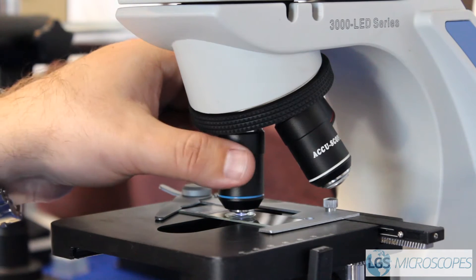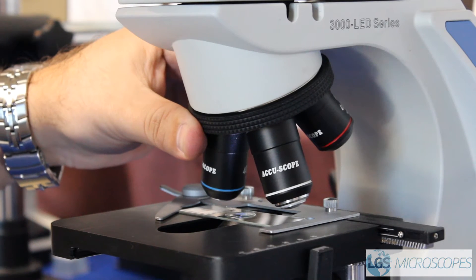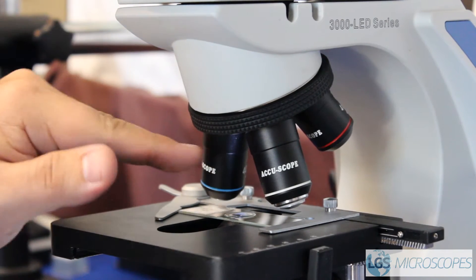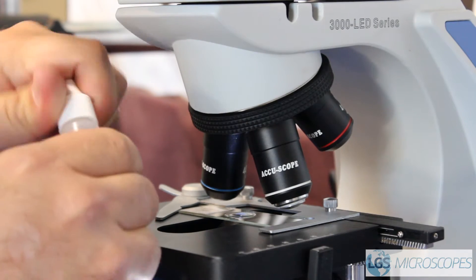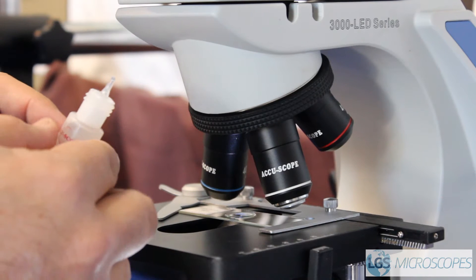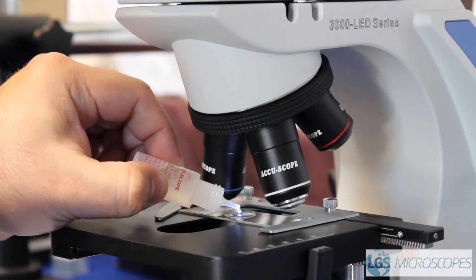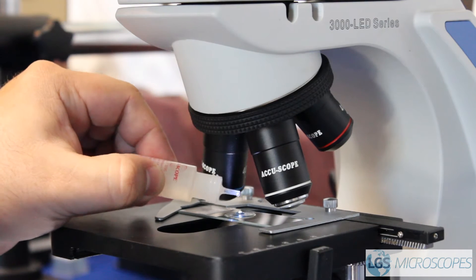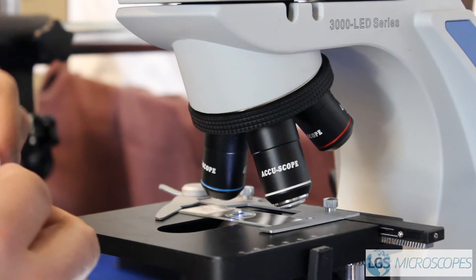So I'm going to show you the proper way to use immersion oil. What we're going to do is move the objectives to where you're right in between the 40 and the 100. I'm going to take our immersion oil — and all you need is one drop, just one little drop right there in the center. Go ahead and put one — we'll say a generous drop — and put our cap back on.